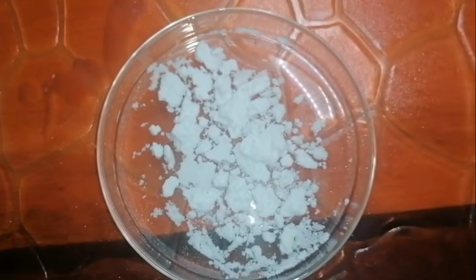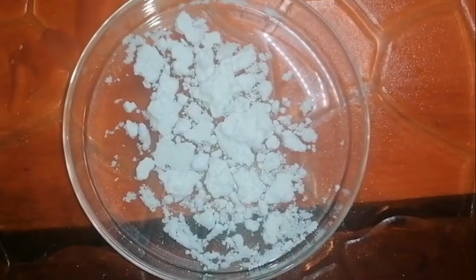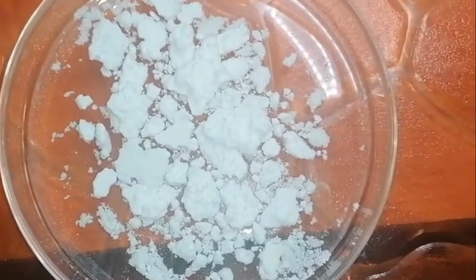Hello my fellow alchemists! Today we are going to synthesize sodium nitrate using sodium bicarbonate and nitric acid.